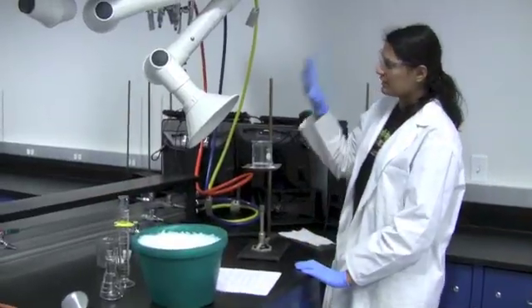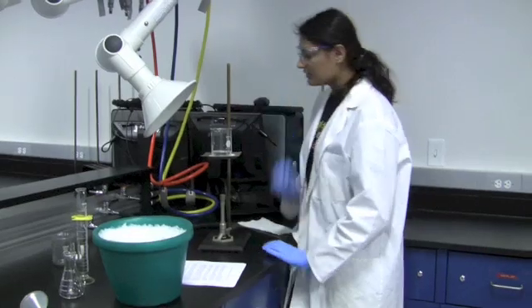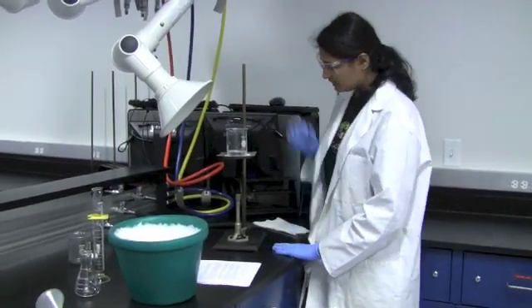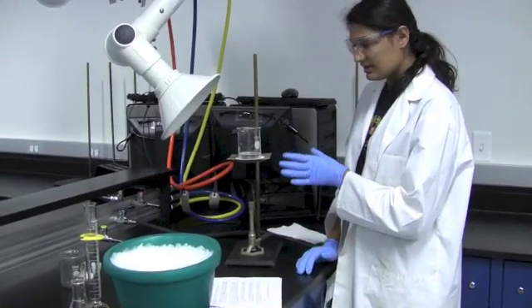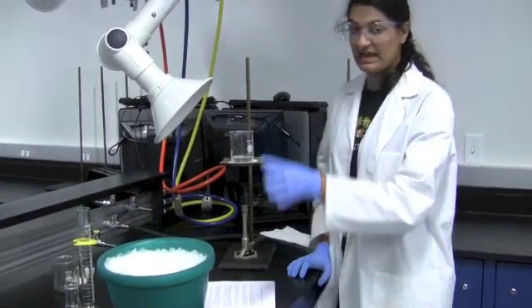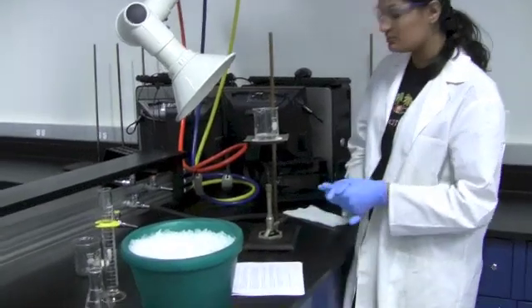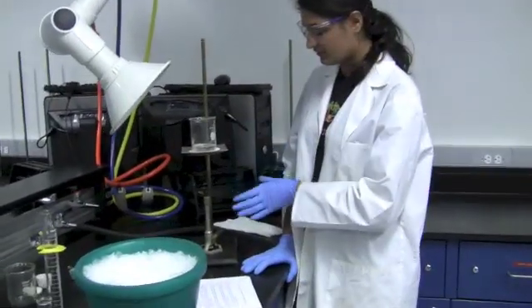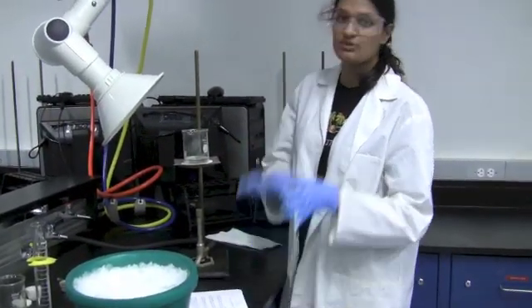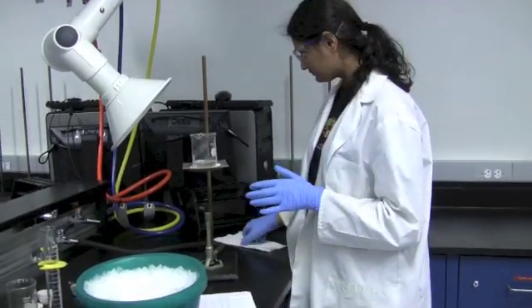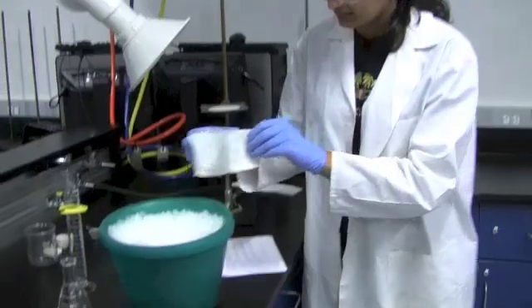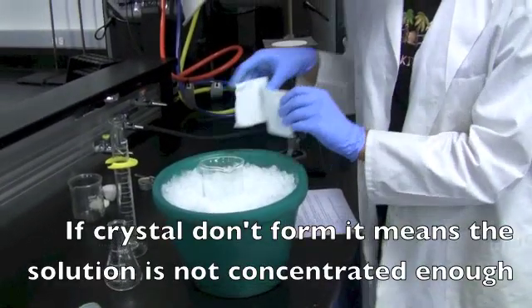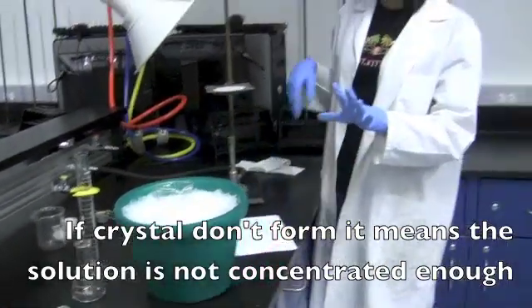Now remember, you're going to be doing everything under the hood. So once your precipitate has completely dissolved, you're going to have a clear solution once again. And now you're going to want to take the clear solution, turn off your Bunsen burner, take the clear solution and add it to an ice bath. However, you never want to directly take your beaker from the Bunsen burner to the ice bath. You want to wait about a minute for it to cool. Once it's cool, you're going to take it, place it inside the ice bath, and make sure that you keep it as motionless as possible.